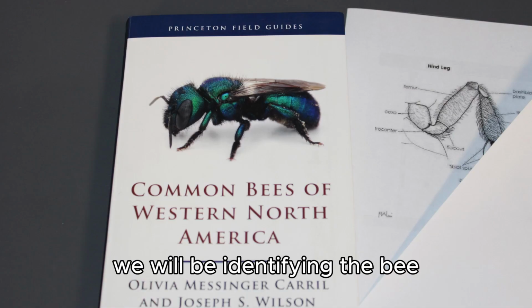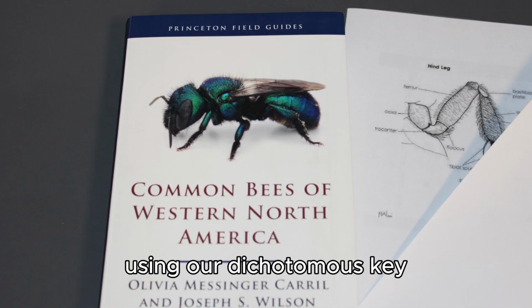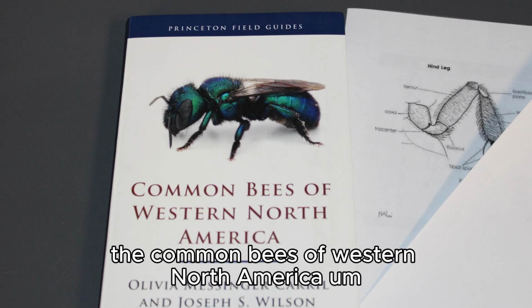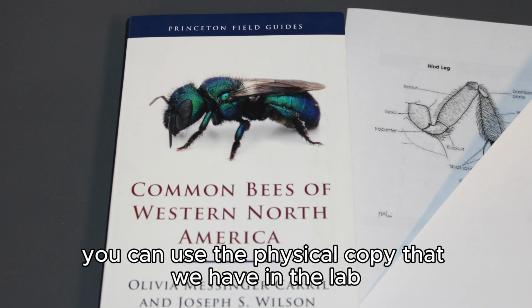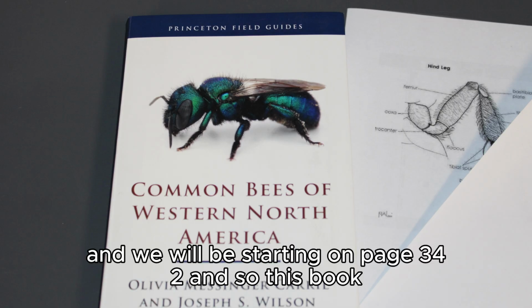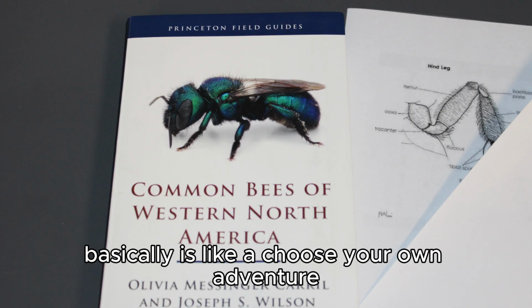We will be identifying the bee using our dichotomous key. So we will be using the Common Bees of Western North America. You can use the physical copy that we have in the lab, or you can use the digital copy. It's the same exact thing. And we will be starting on page 342. This book is basically like a choose your own adventure.